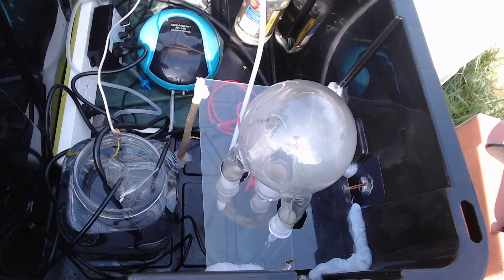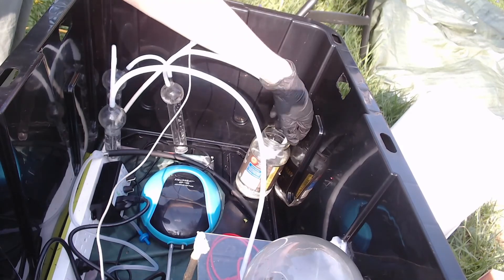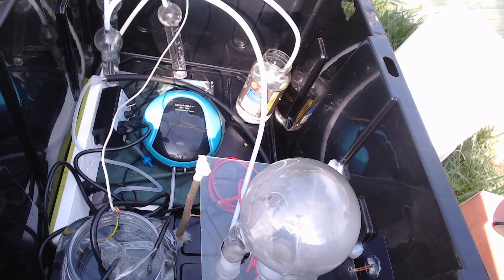I probably shouldn't keep the end open for too long — it's just a bare PTFE tube with nothing on the end of it. Hopefully by the time the gas gets to that point, most of the nitrates will have been absorbed in the bubblers. The duty cycle timer is set to reset the transformer in case it arcs out, making it a little less necessary to babysit. Yeah, it's doing it.